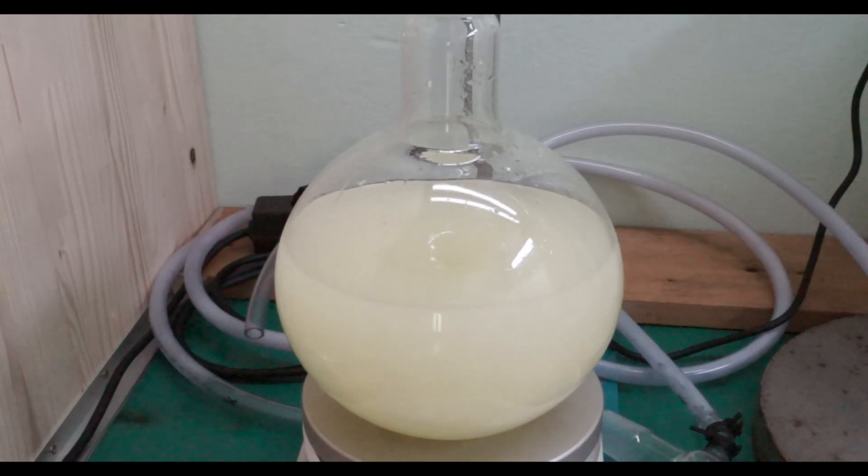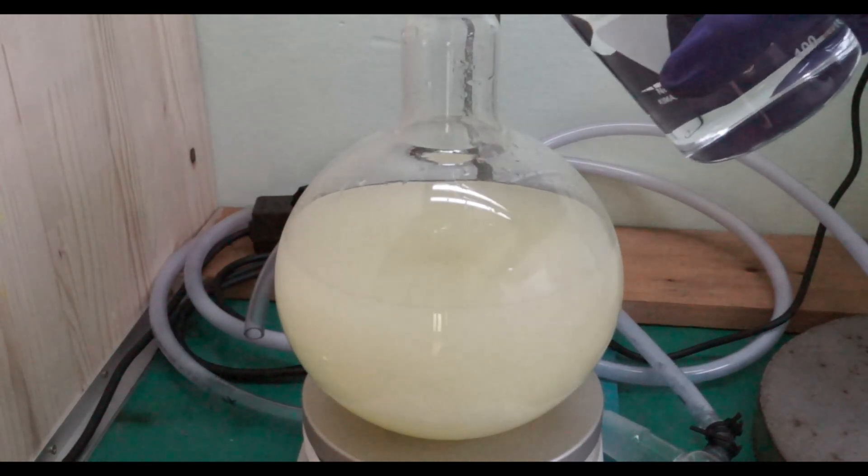After the majority of calcium chloride is dissolved I added the isopropyl alcohol.